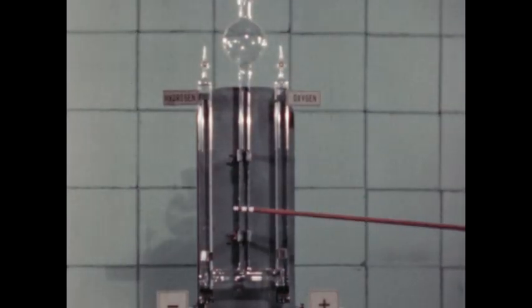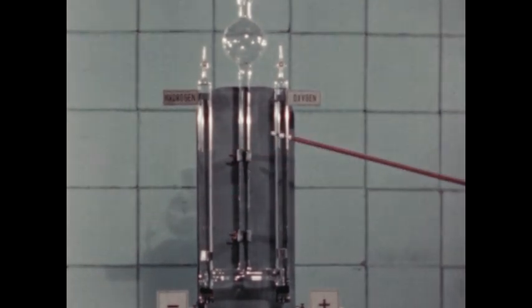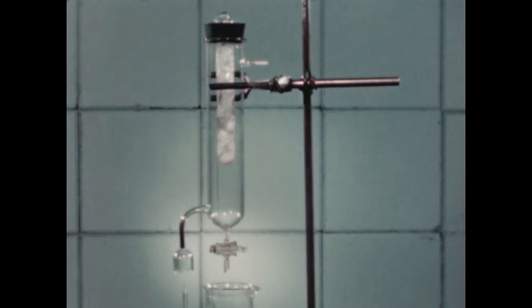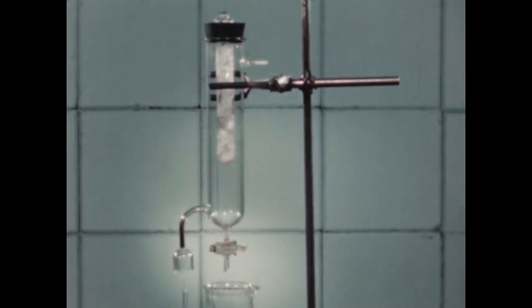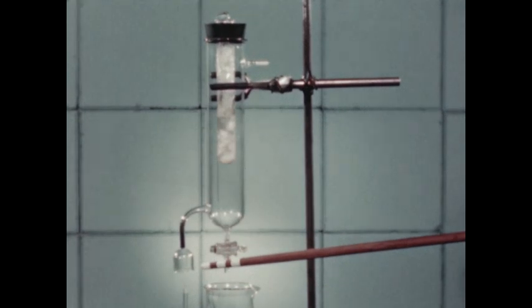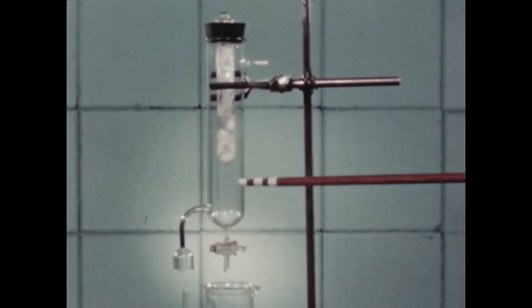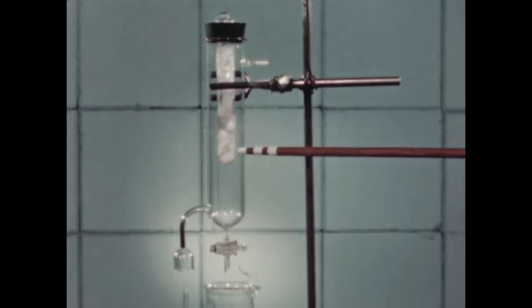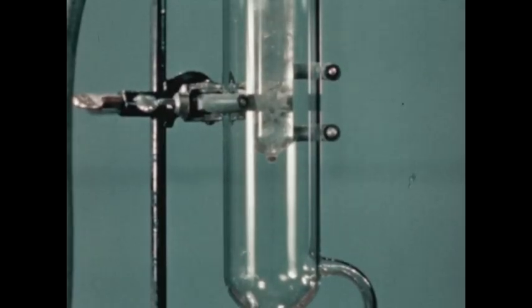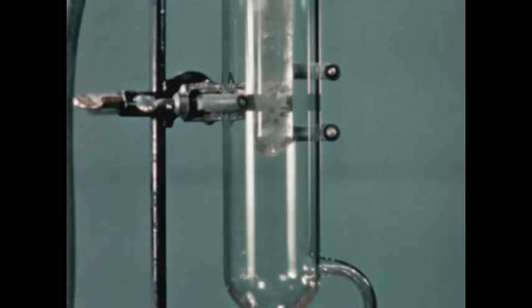We have seen the decomposition of water to produce the elements hydrogen and oxygen. Here is a simple apparatus with which we shall reverse the process. Suction applied here draws air past the hydrogen flame. When the oxygen in the air combines with the hydrogen, water vapor is formed and condenses on the ice-filled test tube.